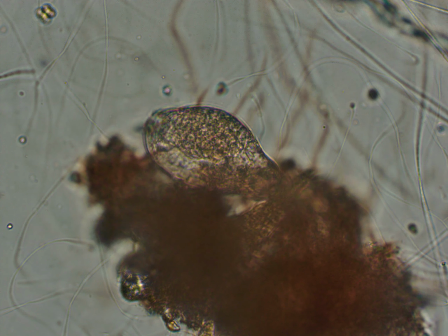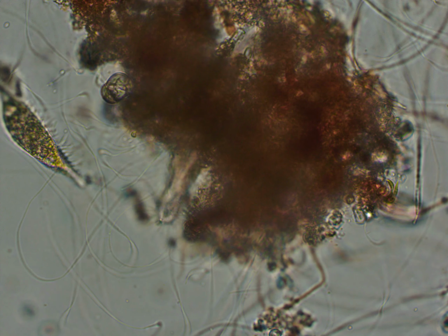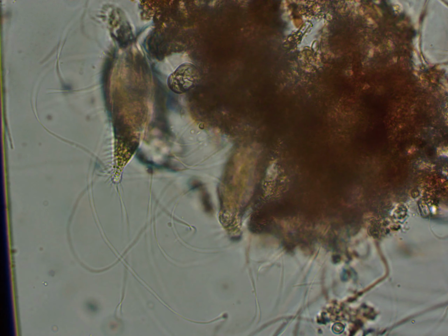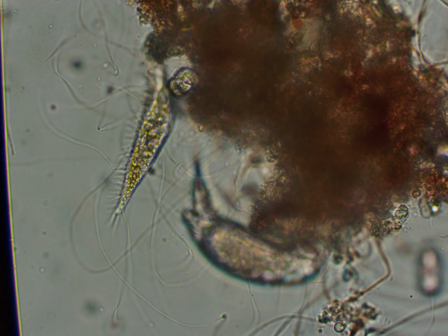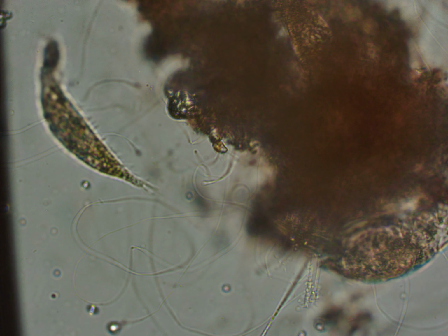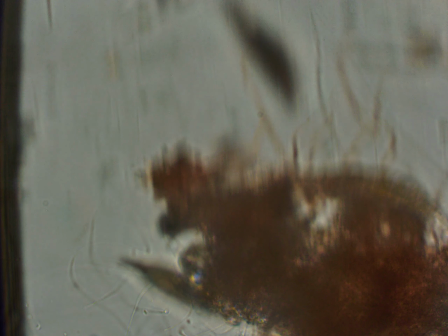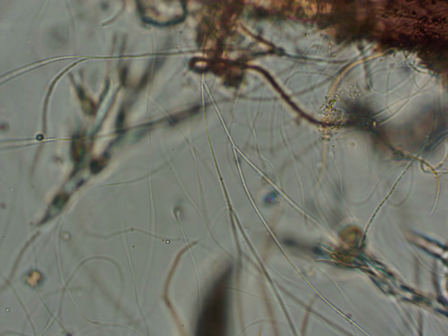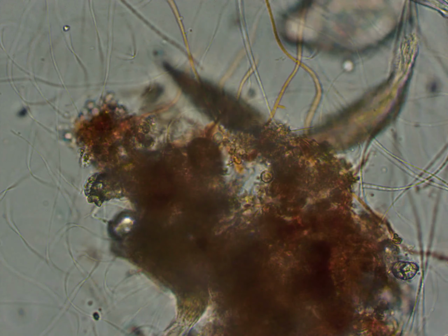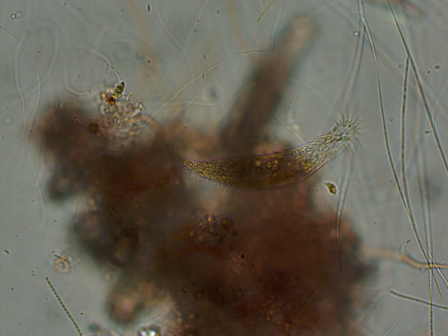And here is two of those rotifers again, and there is two small organisms called Uroleptus. They sometimes look like a skinny oxytrich, but they are a hypotrich. And you can see all of those cilia. They have this odd-looking, almost asymmetrical-looking body, as you can see, with those cilia appearing to only be on one side, but they do actually go over the entire body.